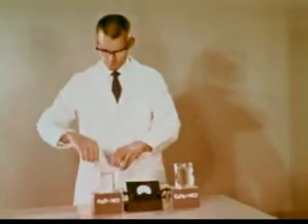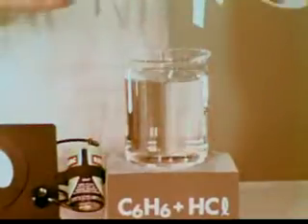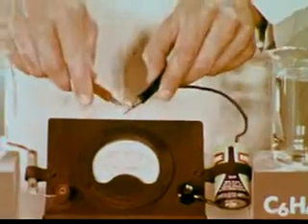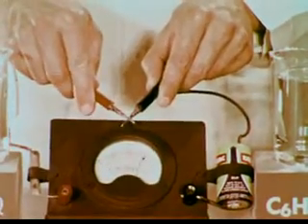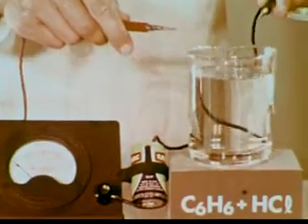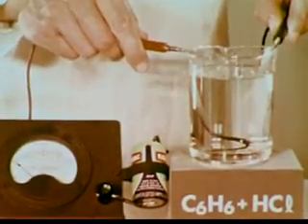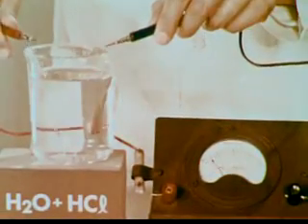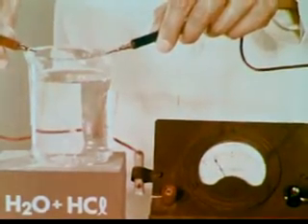We'll measure the conductivity of the two solutions, first placing silver electrodes in each beaker. Touching the probes causes a meter deflection, which indicates conductivity. However, the HCl in solution in benzene does not conduct appreciably. By comparison, HCl in water is a conductor. How do we account for this difference?